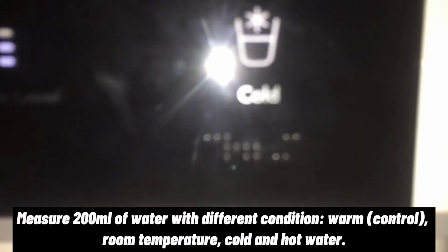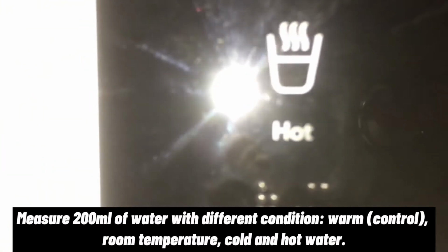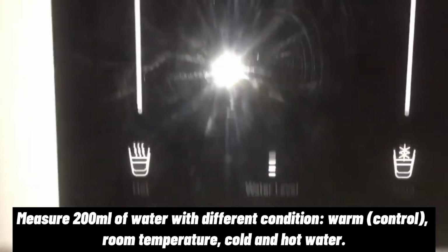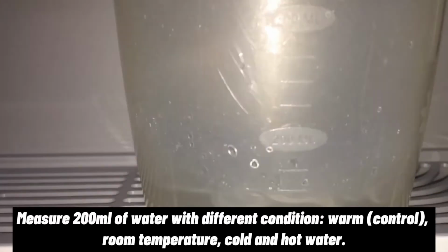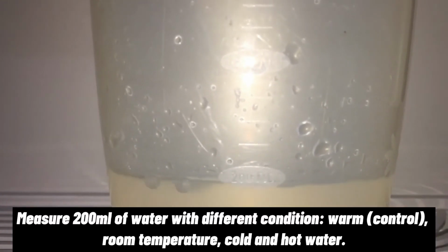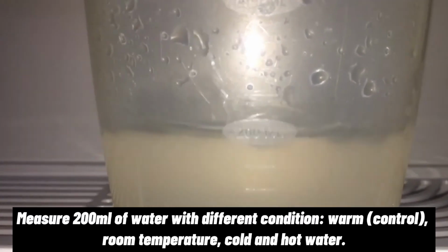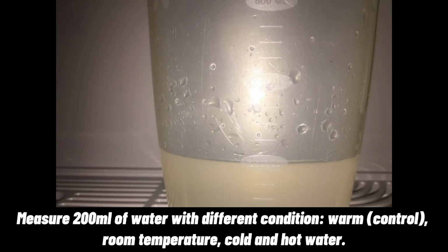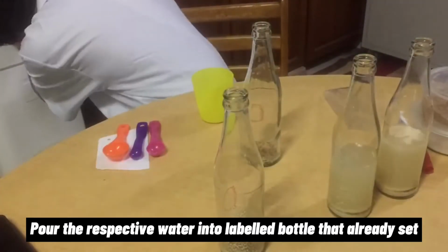In this experiment, we're going to use different water conditions. So, get the water of each condition by using the water machine that provides different water conditions, which is warm water as our control, room temperature water, and cold water, and also hot water. And then we're going to measure 200 ml of water by using a measuring jug, and then pour the water into each of the labeled bottles that we already set.